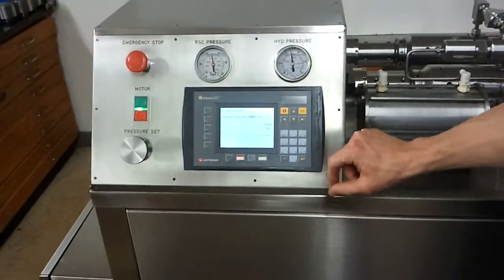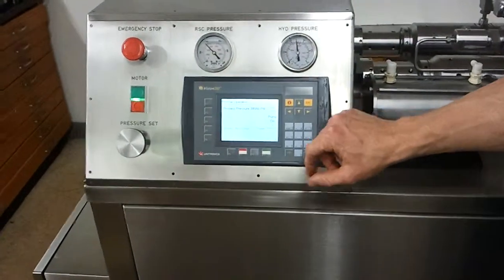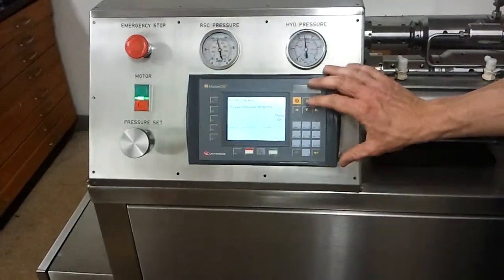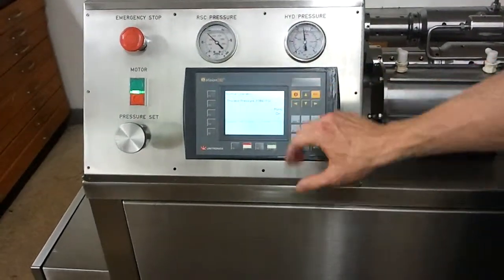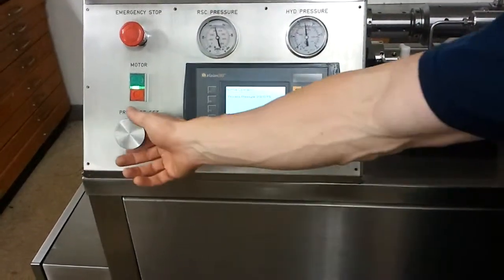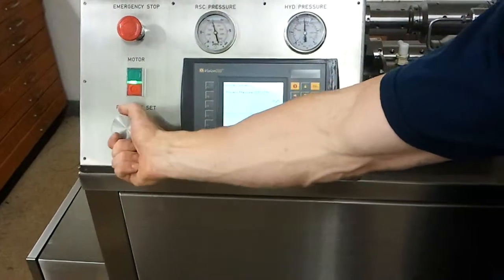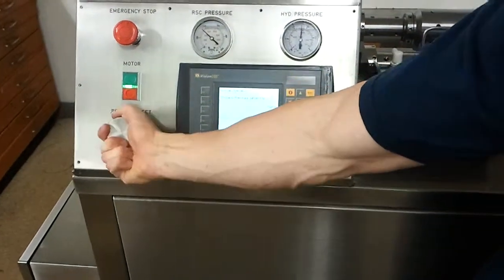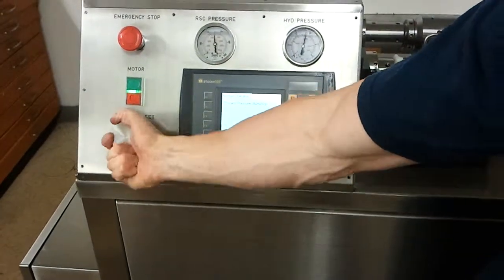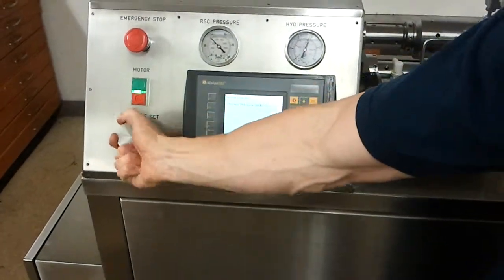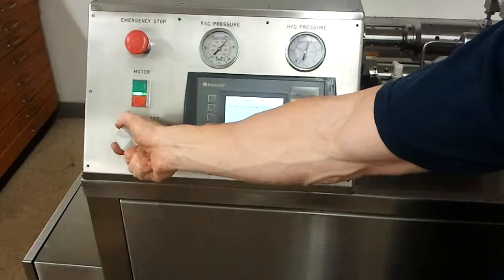We'll start the machine. You can read process pressure. You can increase it up to 45,000 PSI.